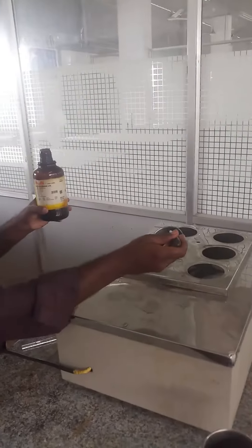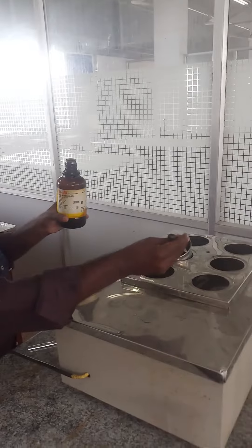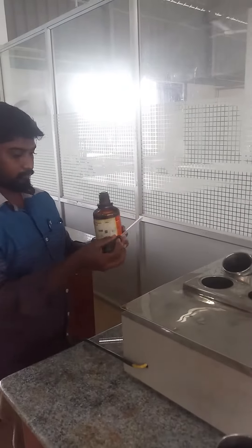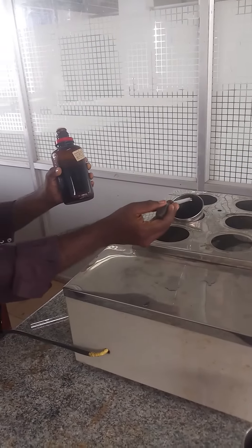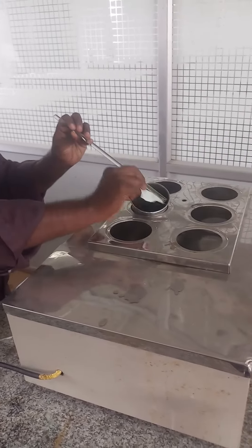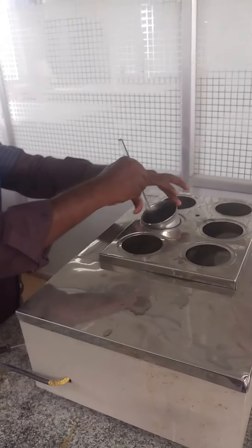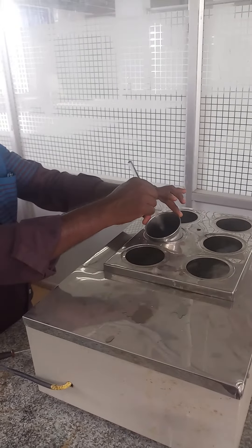The required amount of acetic acid has been added to the dye bath. The required amount of phenol has to be added. The required amount of sodium oleate has been added to the dye bath. The dyeing has to be carried out for 60 to 90 minutes at boiling temperature.